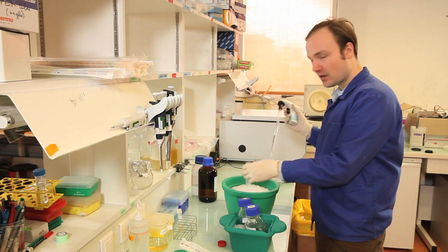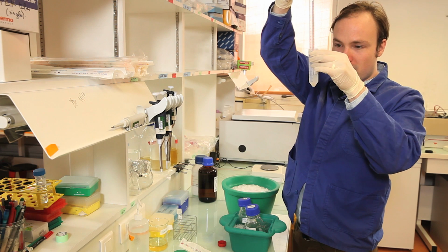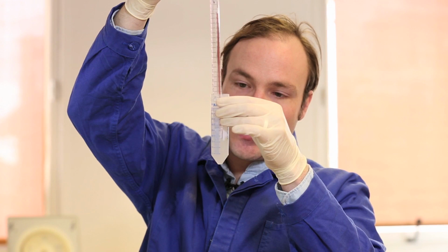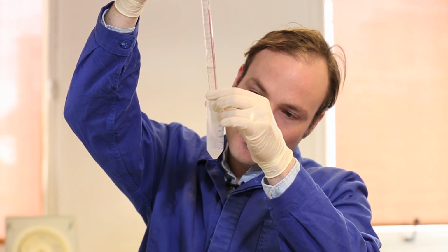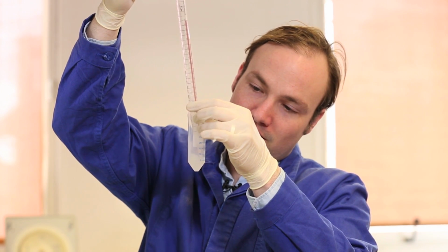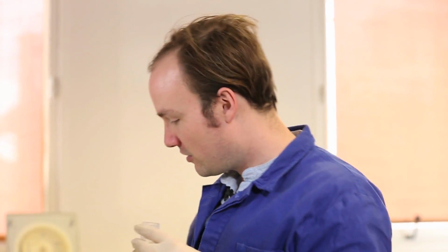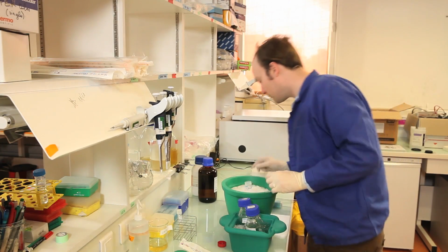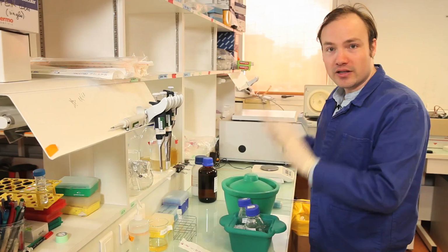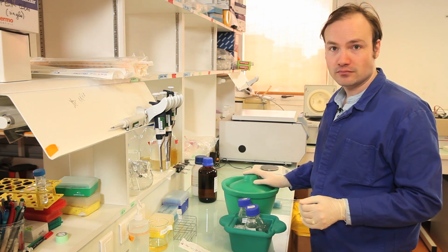Okay. So I'll resuspend the cells by pipetting up and down. The pellet should come apart pretty easily after a few rounds of pipetting, giving us a nice uniform resuspension of cells. We don't want to spend too long doing this, or the cells will start to warm up. Okay. Now I'm going to leave these cells on ice for at least 4 hours, or it could be longer, even overnight.